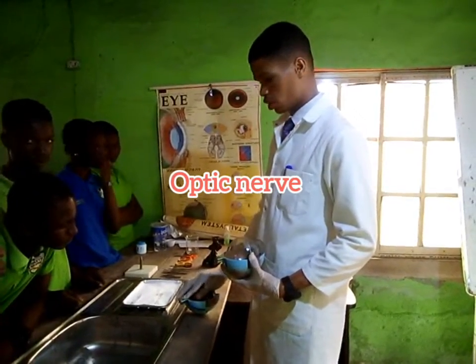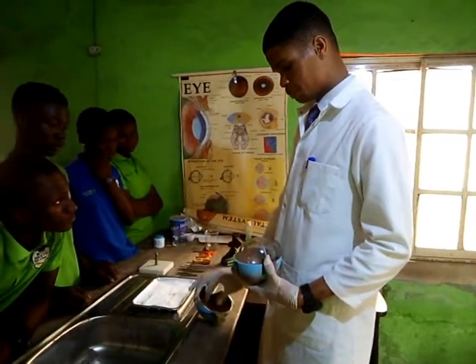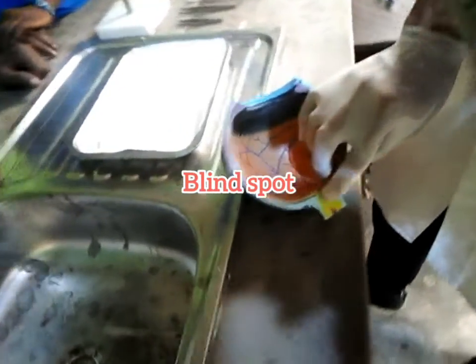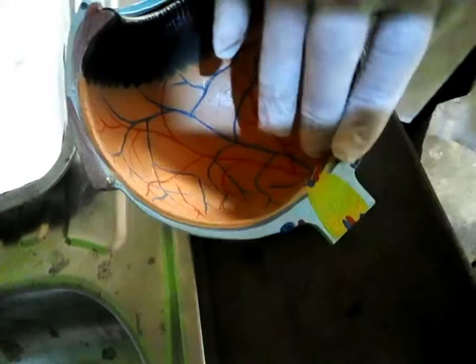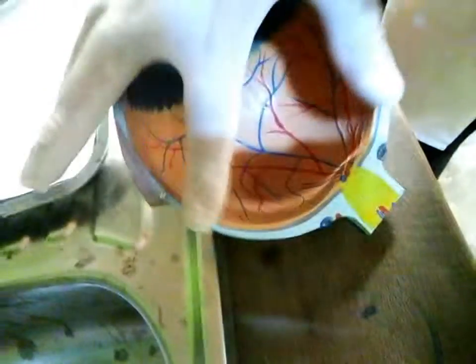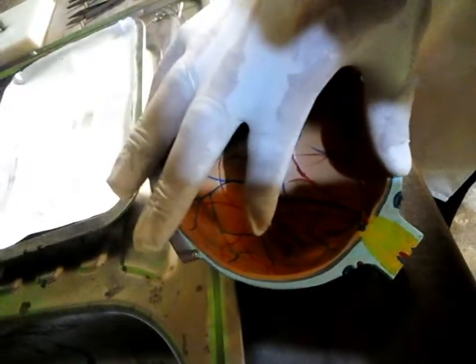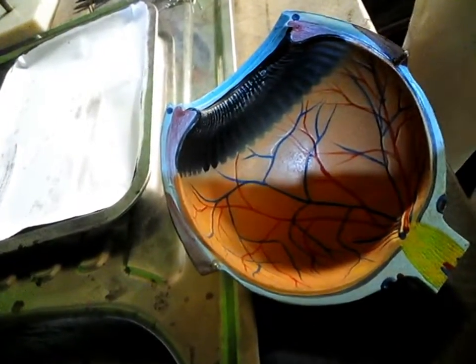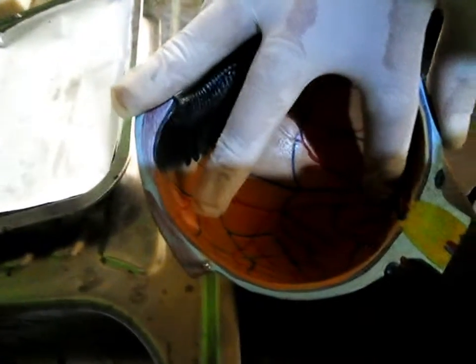This is what we call the optic nerve. Now this part is what we call the blind spot, the point where the optic nerve is. What's the function of the optic nerve? The optic nerve is connected to the retina, which is what you are seeing. I told you the retina is made up of sensory cells.